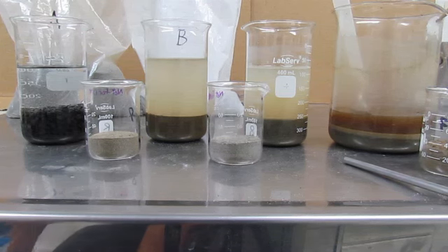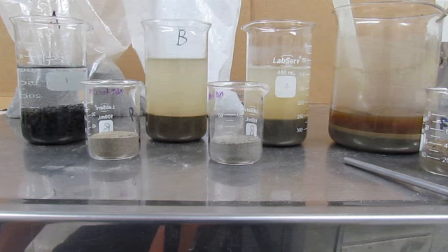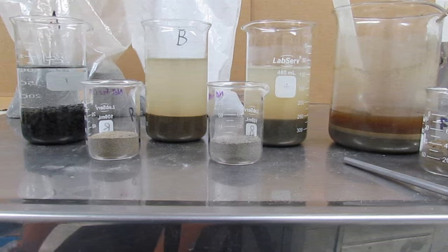Right, g'day. When selecting sands and evaluating the quality of the sands, particularly particle size distribution, when we're doing it by mechanical method, that is strictly by dry sieving or wet sieving as opposed to the pipette method, we want to make a decision on whether it should be dry sieved or wet sieved, and that really comes down to the amount of fines that are in the sand.